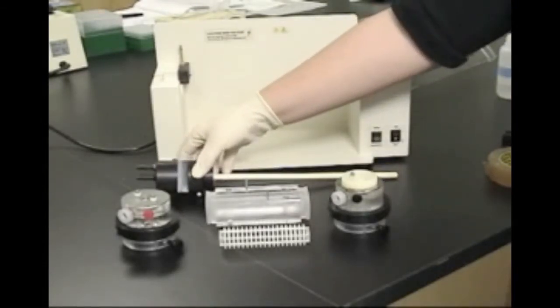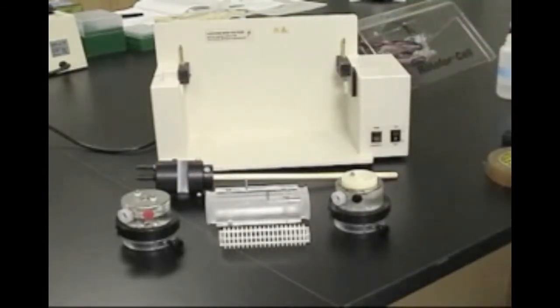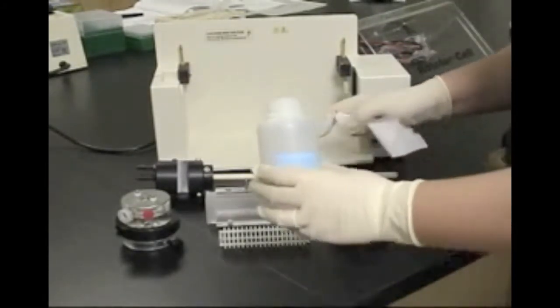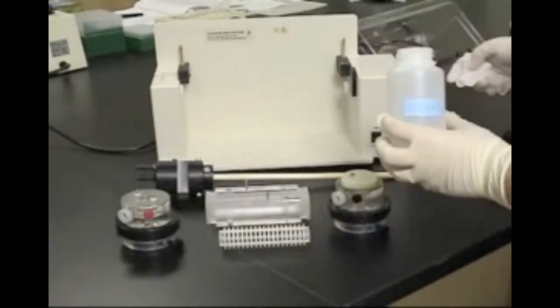All components again will be assembled around the cooling finger. To facilitate assembly, it is recommended that you apply a liberal amount of glycerol to the cooling finger.